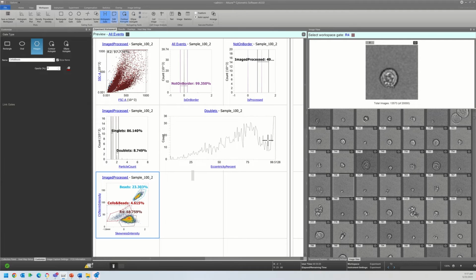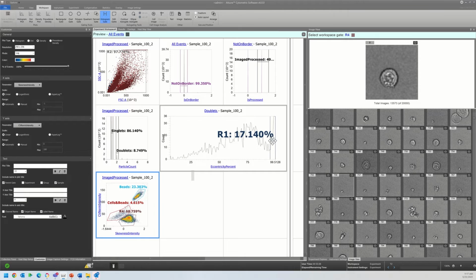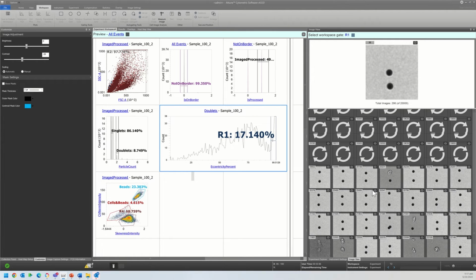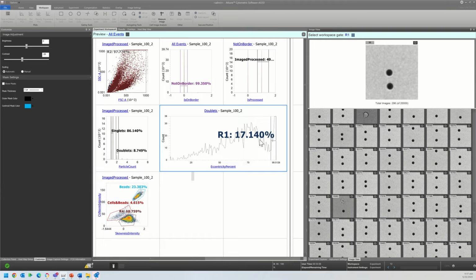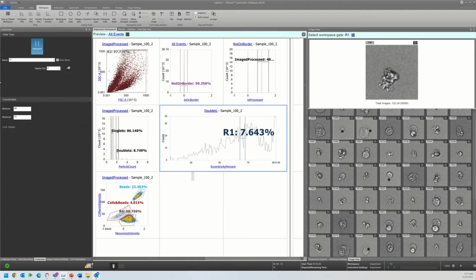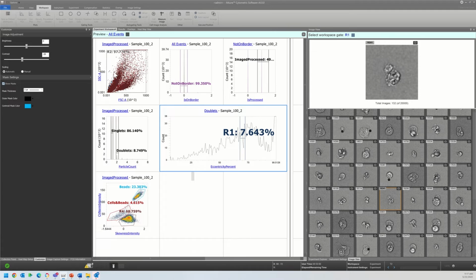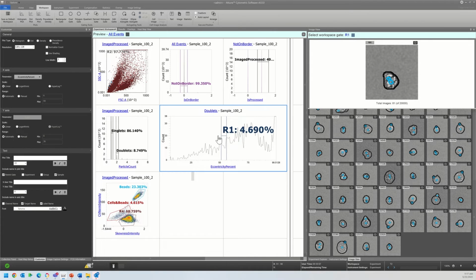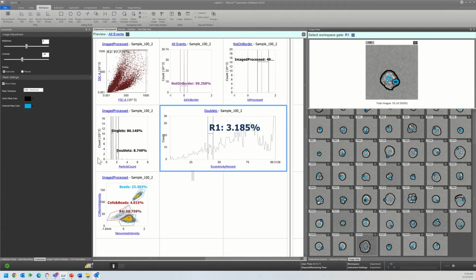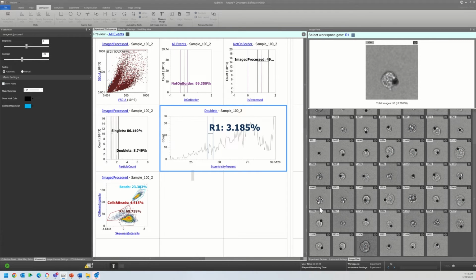And so if we come up here, and I'm just going to show you on this plot before we look at our actual cells and beads population. The high eccentricity percent shows us events that are not interacting. Whereas as we move lower, below 75, we start to see more of these events that are actually connected and have some kind of interaction going on. And we're going to see our beads and cell population. There we go. Our beads and cell population here below 50, between the 50 and 25. And so this is a very useful parameter to call out interactions versus coincidental events.